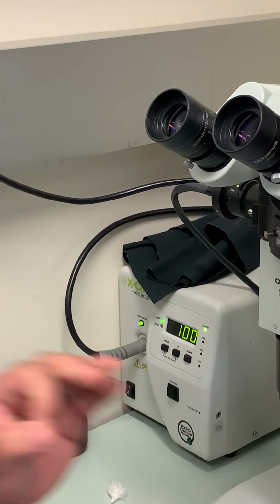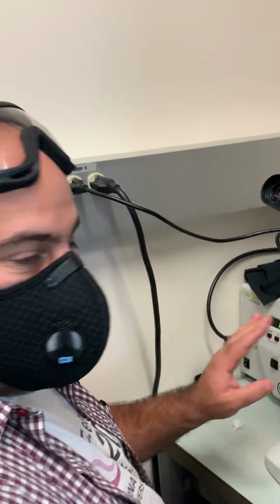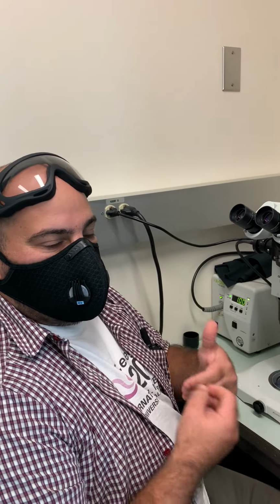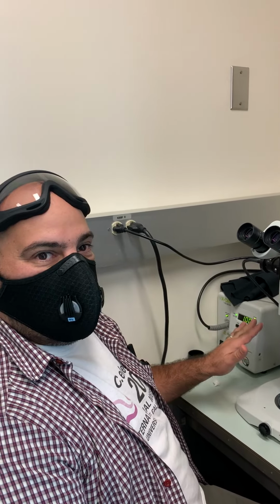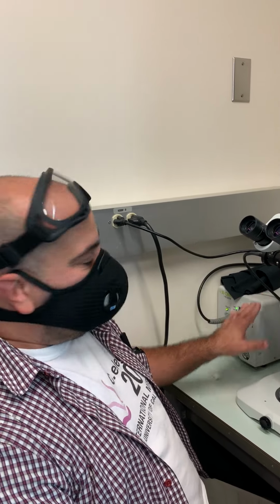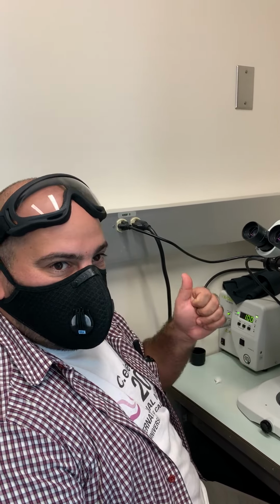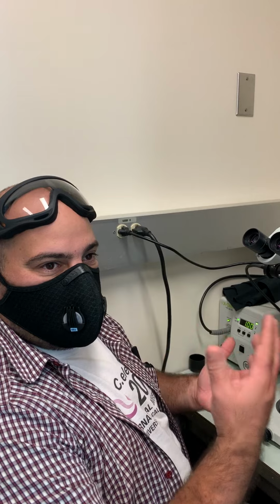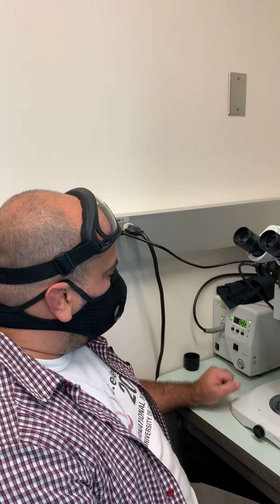Once the power button is on, this needs to be on for the rest of the day. If you are the only person in the lab and you are leaving for the day, then you can turn it off. But if you know there are going to be more people using it, you have to leave it on. Make sure the people who come in know to turn it off before they go. The reason is that the lamp inside loses 4 hours of life every time you switch it on. If you turn it off after 10 minutes and somebody comes back and turns it on again, that's 4 hours every time somebody switches it on and off. So we leave it on for the day.